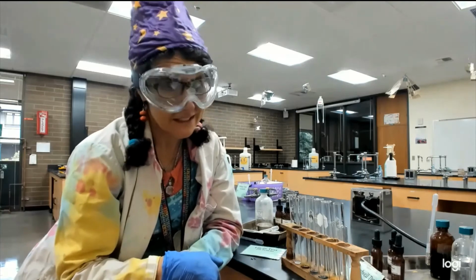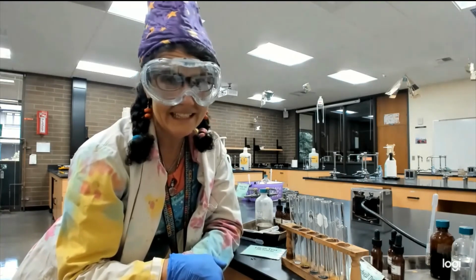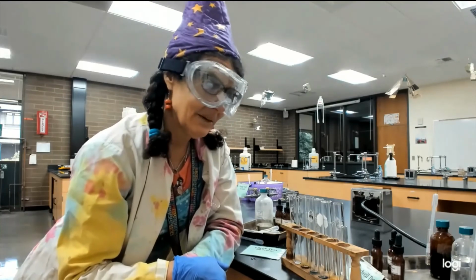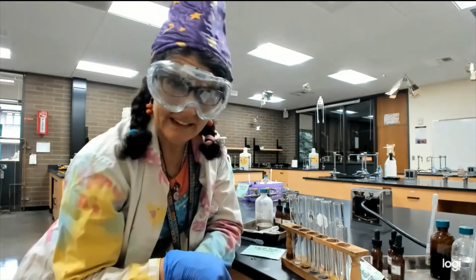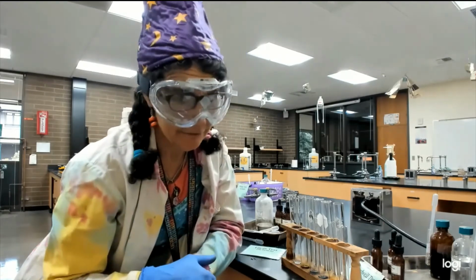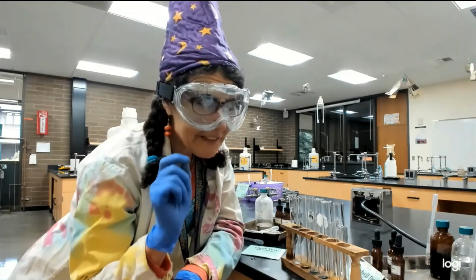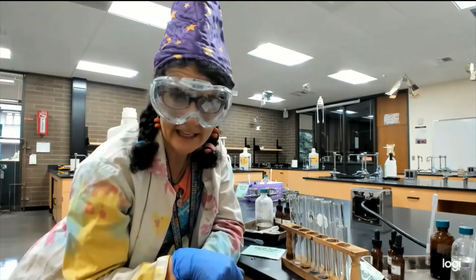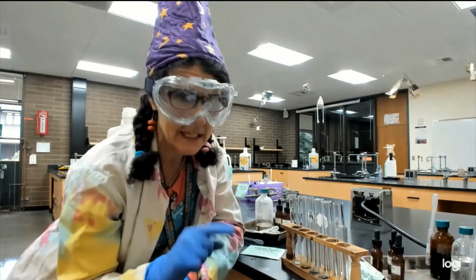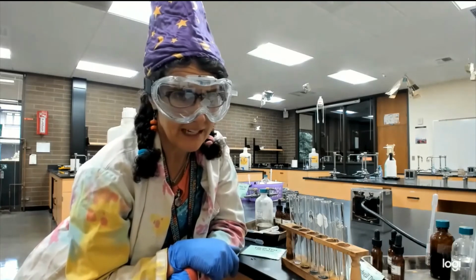So the only one that didn't react was the tert-butanol. Anything that oxidizes, we can get it to oxidize. Now again, the Tollens test that we did like 5 videos ago, Joey's going to have fun splicing this all together. That is a very mild oxidizing agent and only oxidizes aldehydes. It's a definitive test that you have an aldehyde. This test just tells us something can be oxidized.